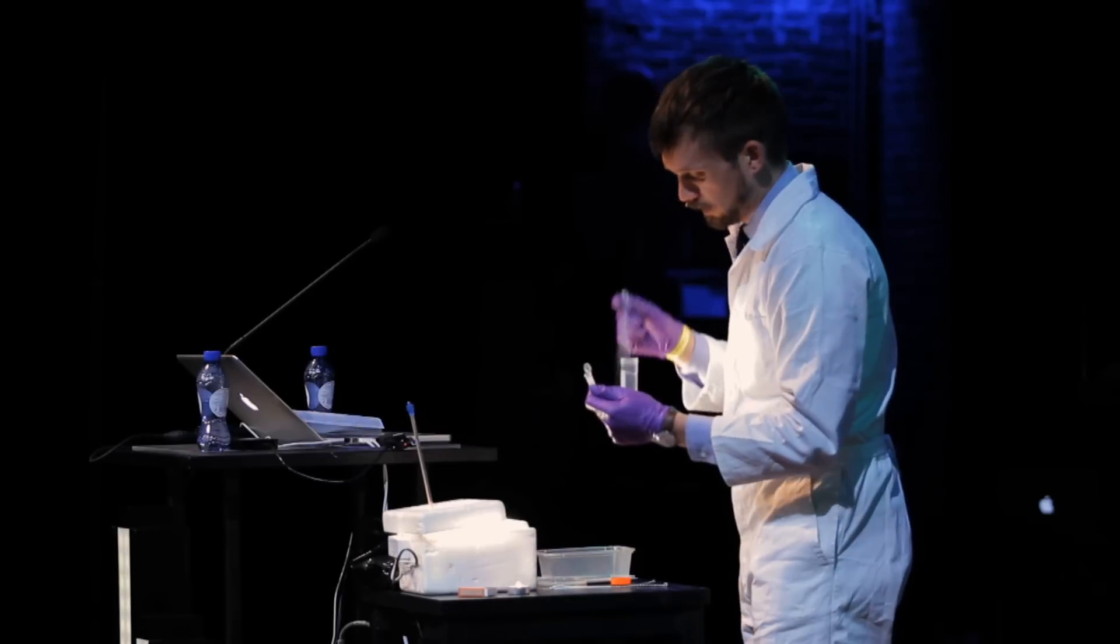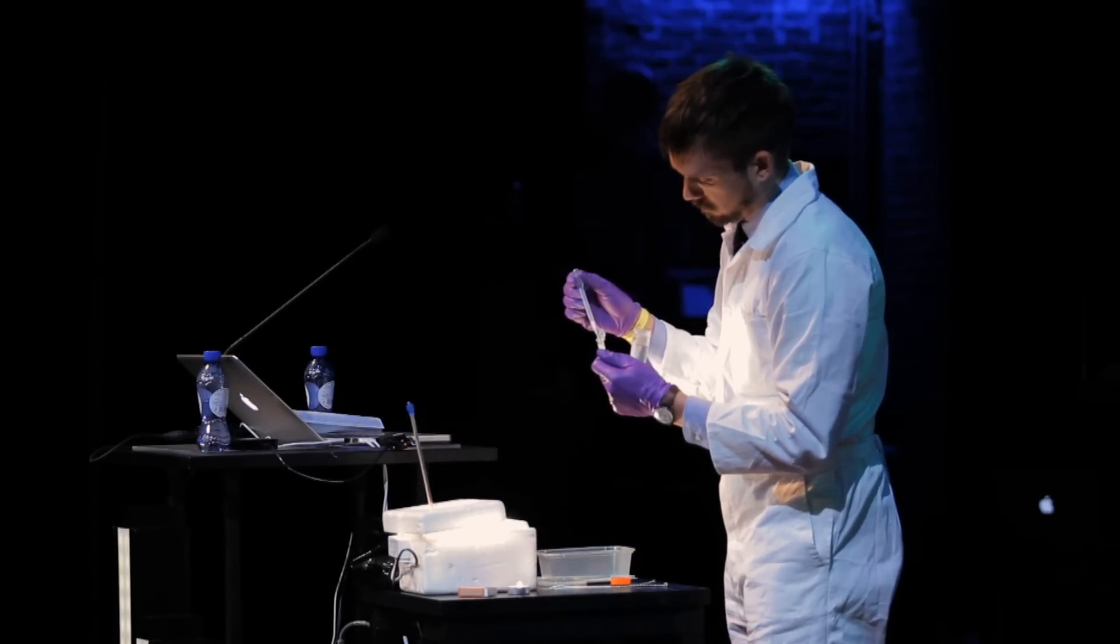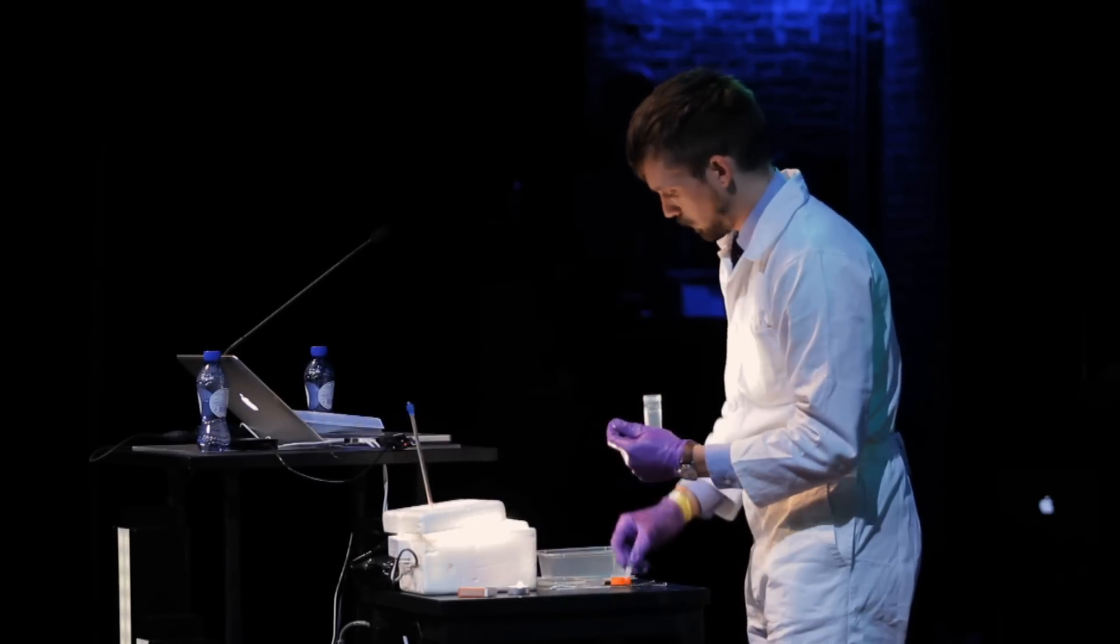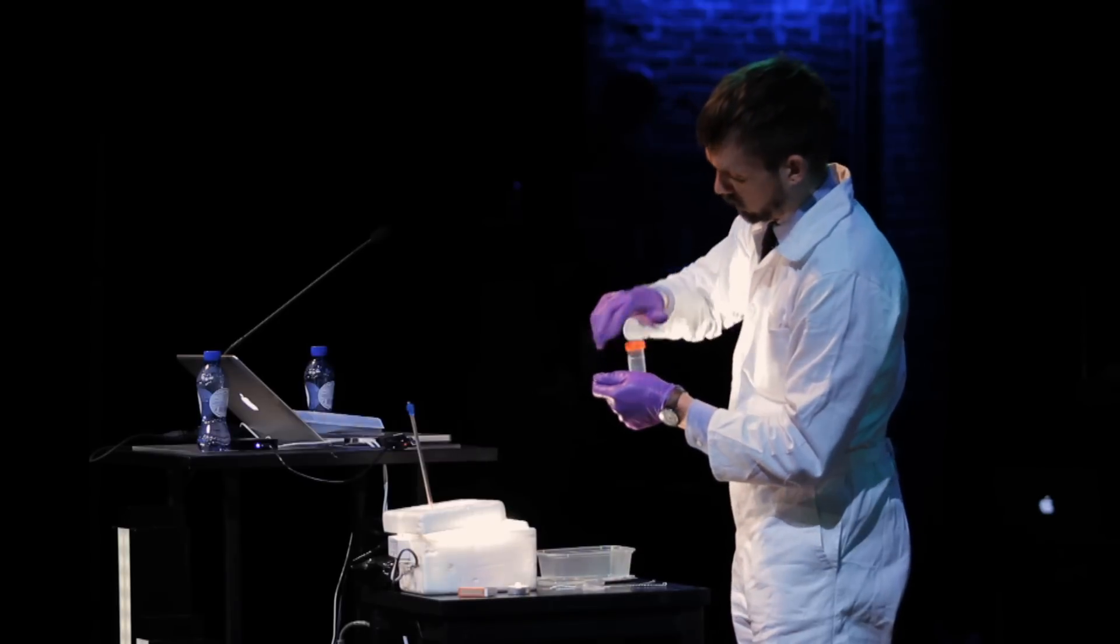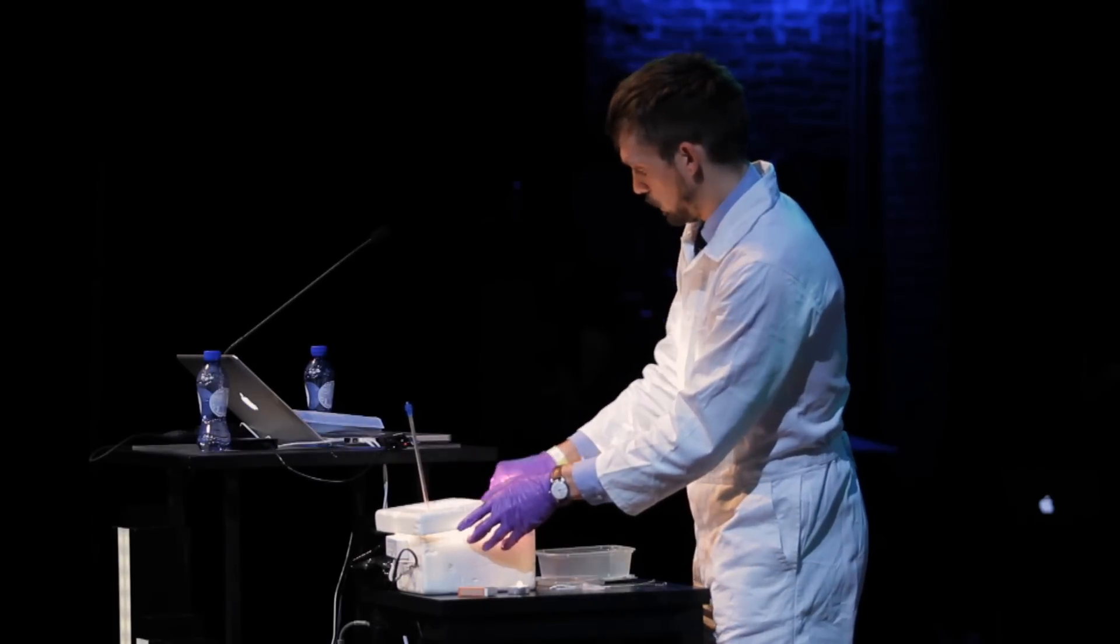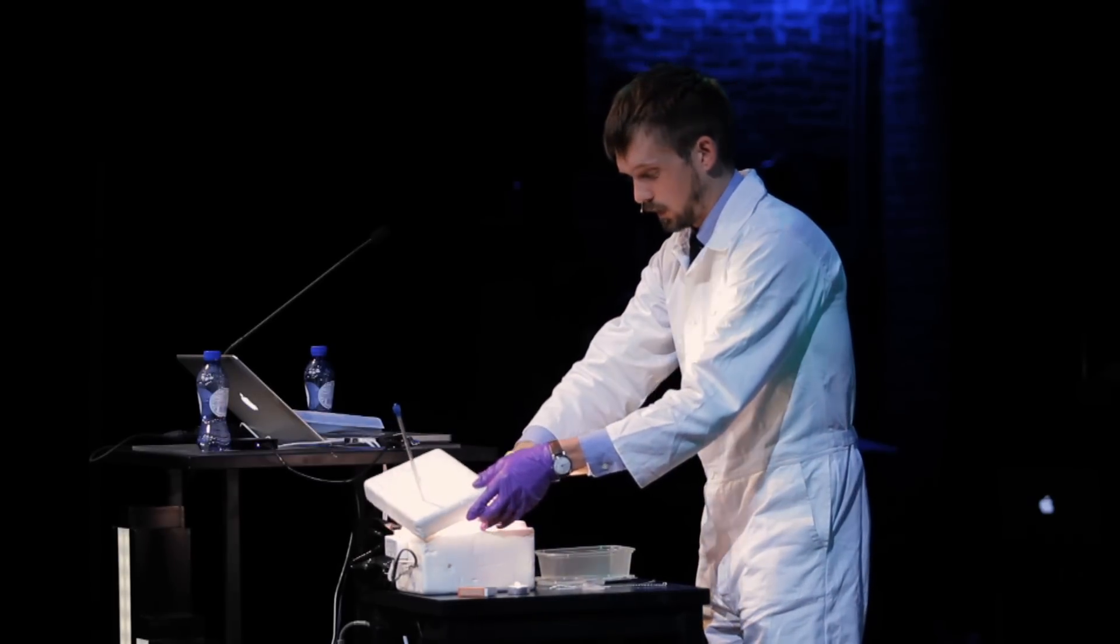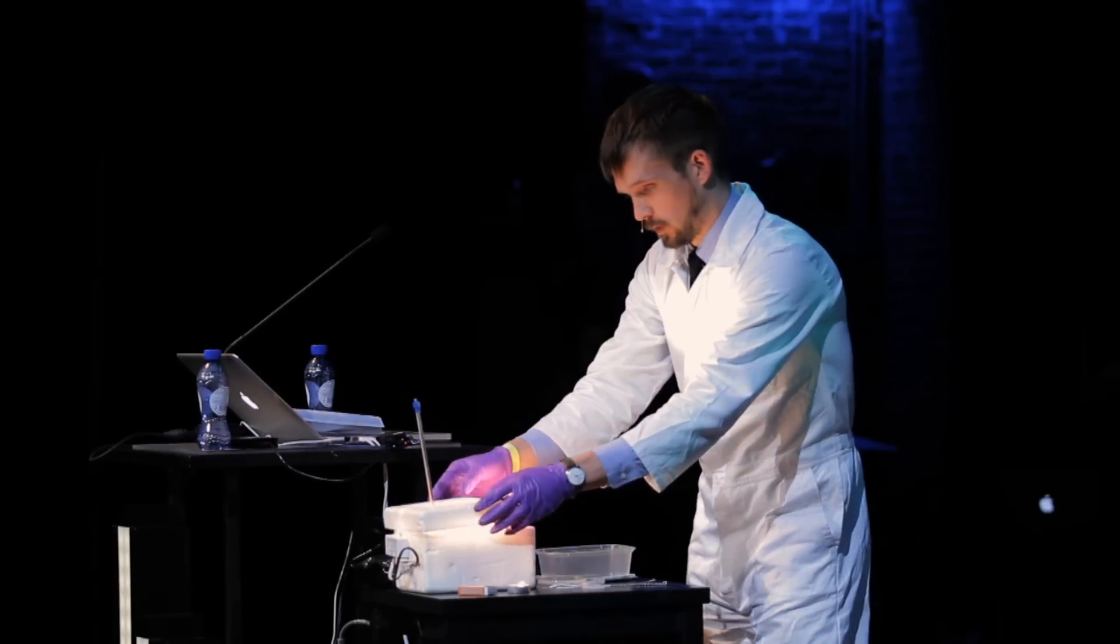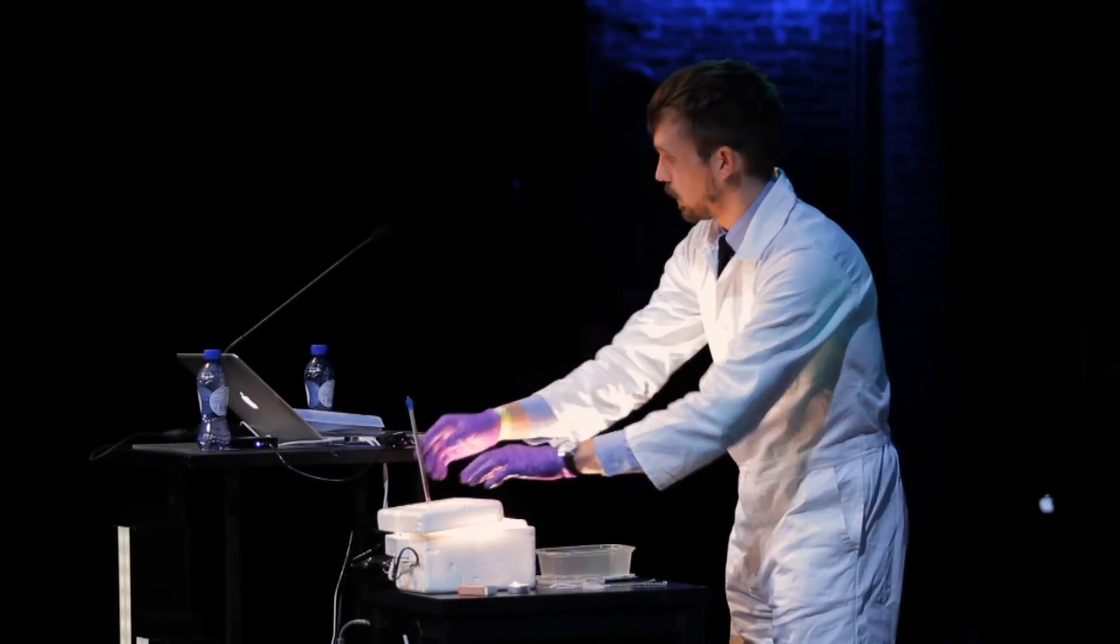So while I add some bacteria to the medium. This medium is just agar. It's like a seaweed bacteria food. And you put it in the incubator overnight. It takes about eight hours. Like so. There we go.